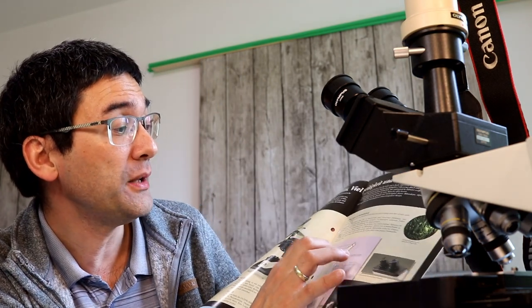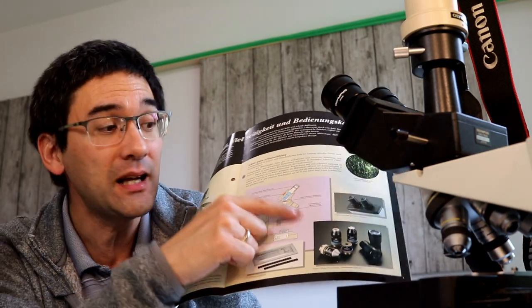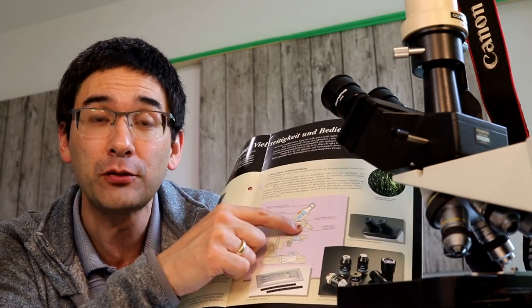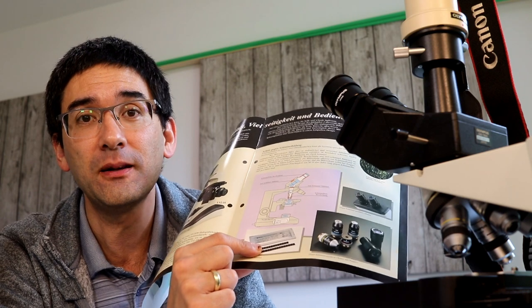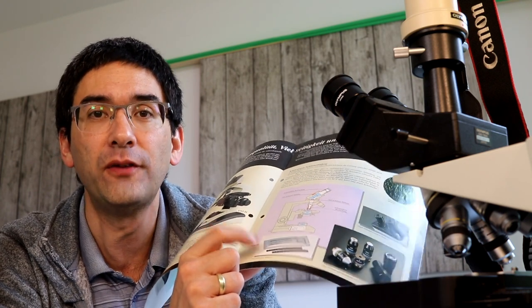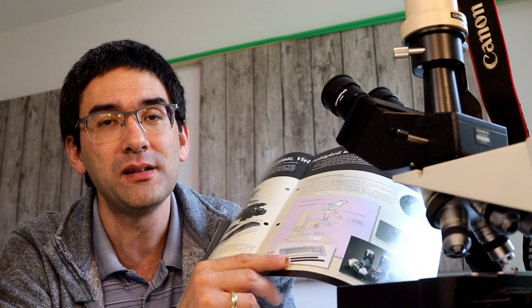So I guess it's some kind of a chemical that is continually released. On the picture here they've got four regions inside a microscope where you have to apply these anti-fungal tablets to reduce the growth of fungi. So it's that much of a problem. It's a well-known problem.